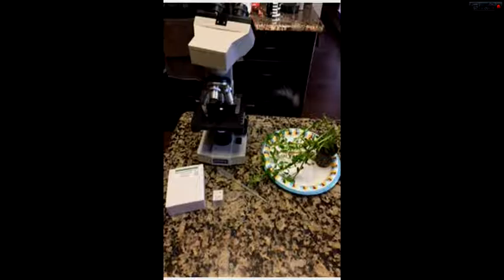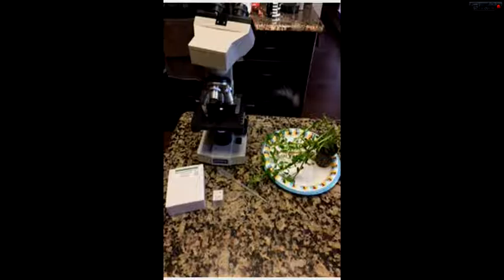The materials and equipment we are using today is a microscope, a concave slide, a cover slip, an eyedropper, an anacharis leaf, and a drawing pencil.